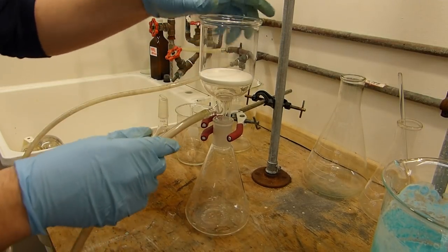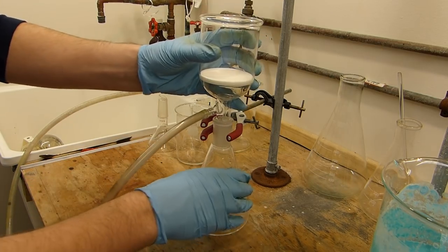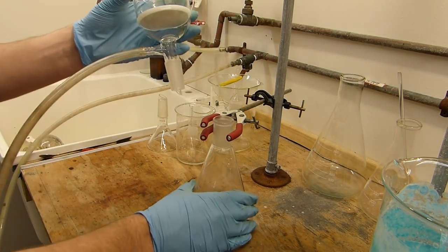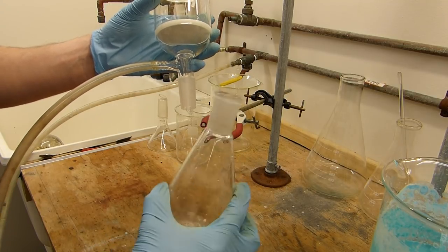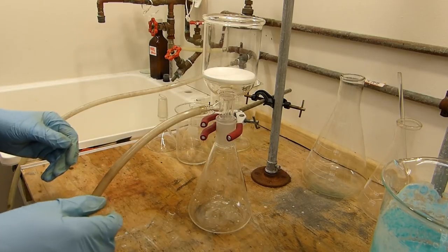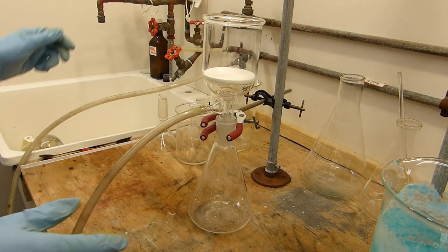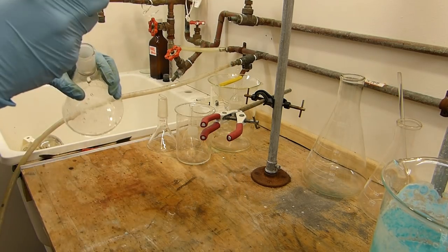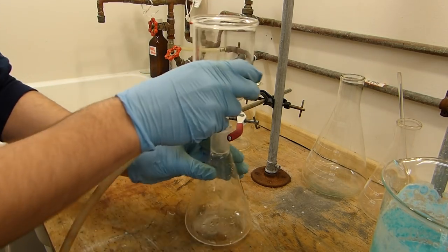So this here is the apparatus. This is my largest filter funnel. It's got a porous glass frit on there. I used one of these earlier, just a smaller version. Unfortunately, this is the biggest jointed Erlenmeyer that I have, so I'm going to have to empty this repeatedly during this process, but that's not really a big deal. So let's get the vacuum started. And again, I apologize for the noise that this may make. And let's keep going.